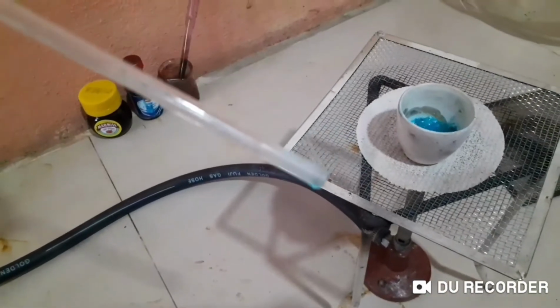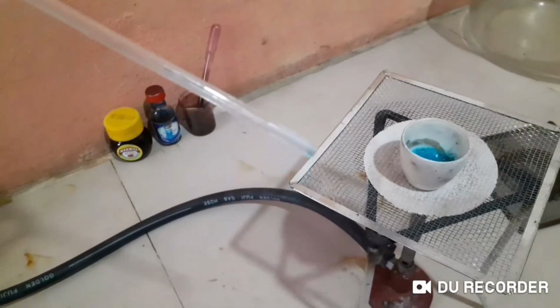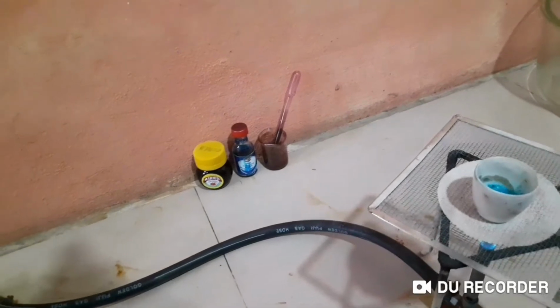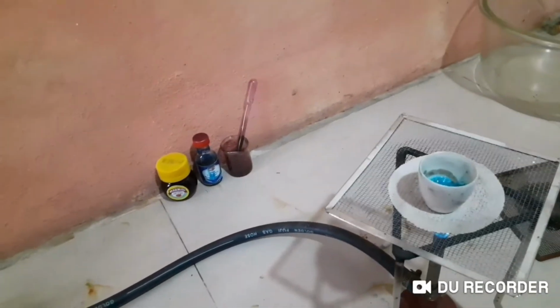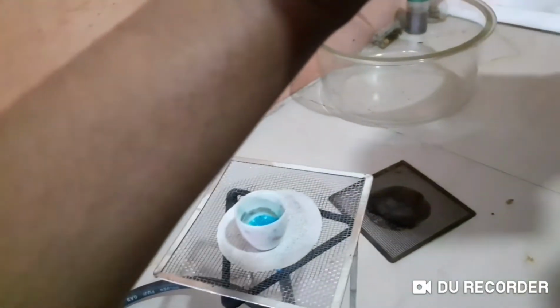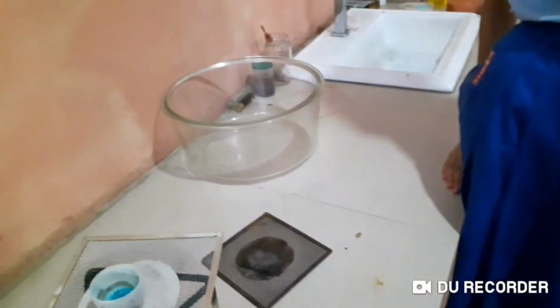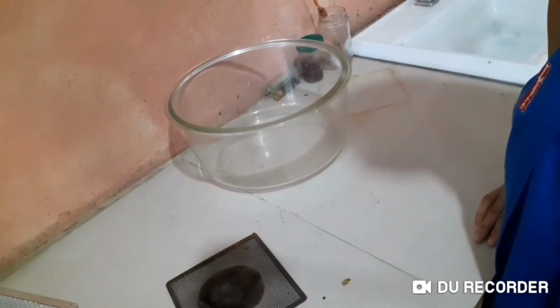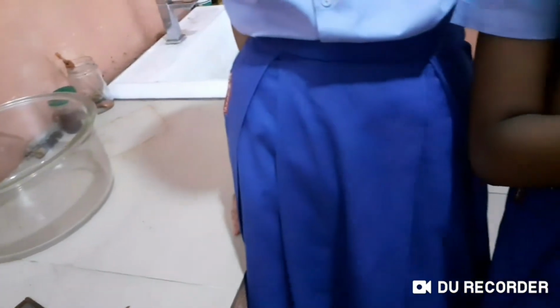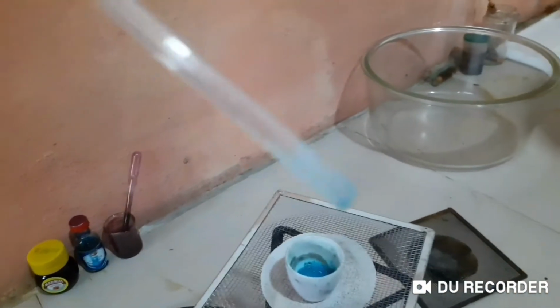It's a little blurry, children, because of the focusing issue, I think. You can see some small crystals, right? Can you see some small crystals here? I can see tiny crystals here. Look at that. It got solidified. That's not blue. It's a very light one. Can you see that? Little white kind of crystals here. Okay, that's how you get it in this case.